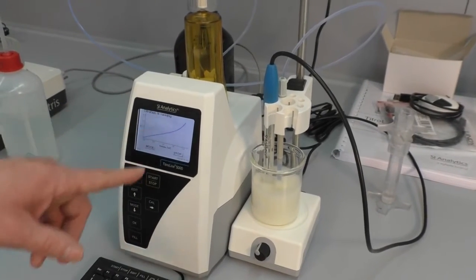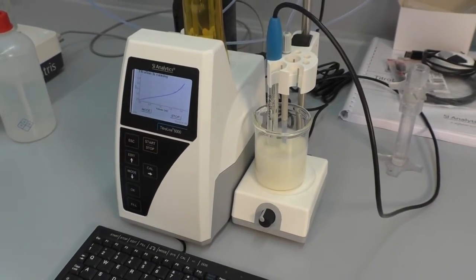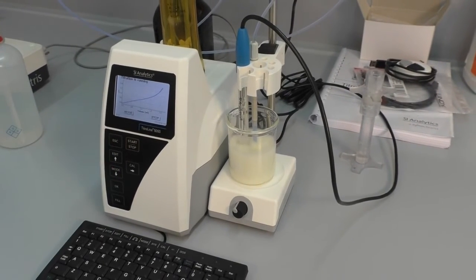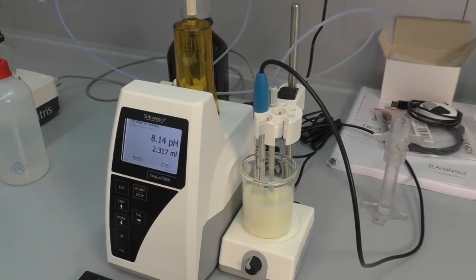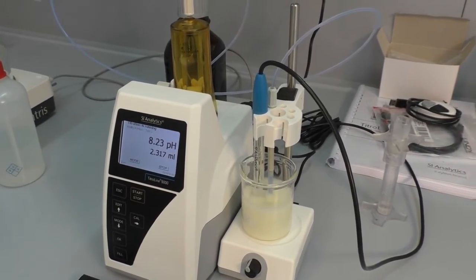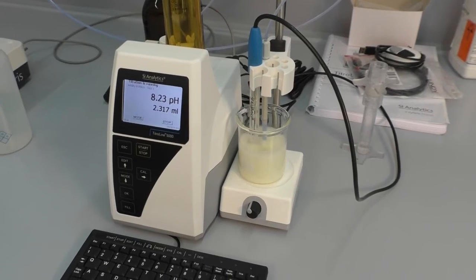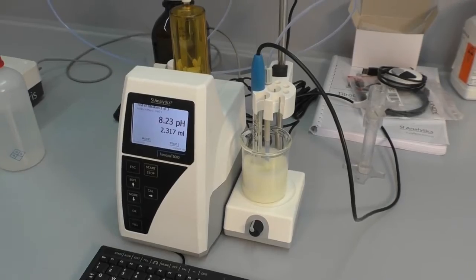At the end of the titration you can see the pH is changing much quicker, and so the titrator stopped the quick titration and changed to a slower titration speed until the endpoint of 8.2 is reached. When the endpoint of 8.2 is reached or higher, the titrator waits some seconds and calculates the result exactly at pH 8.2.